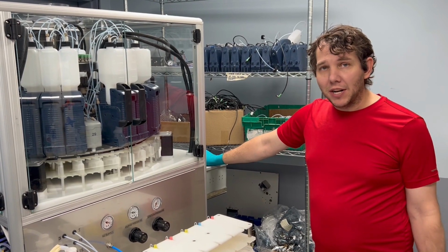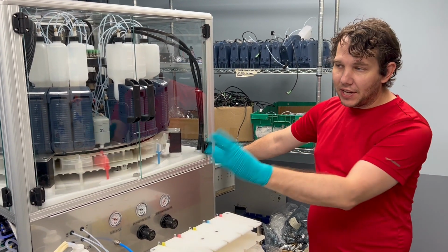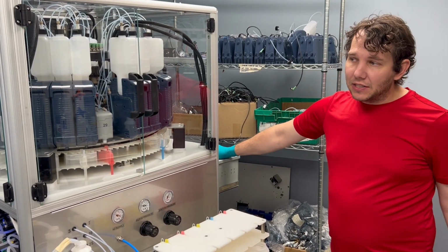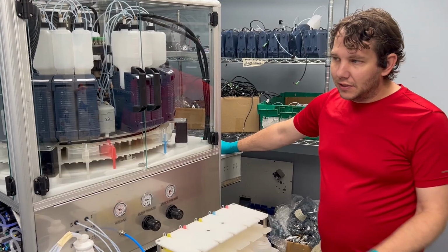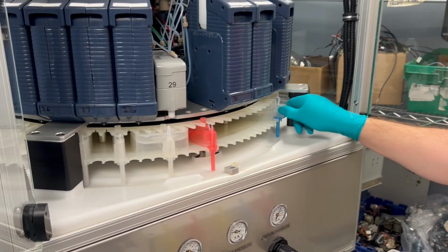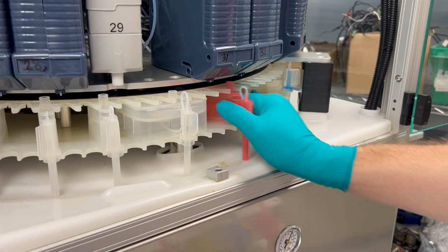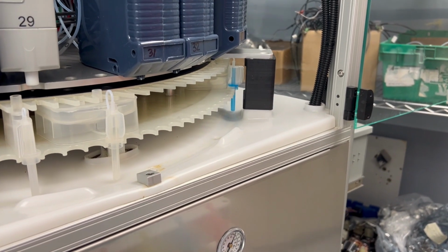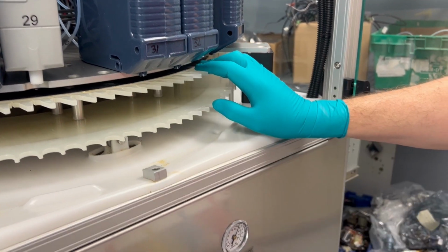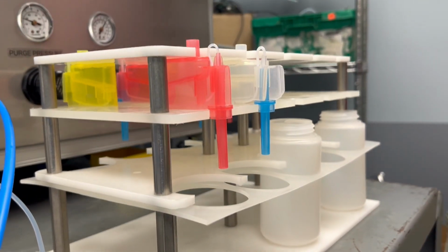Now that we have completed the process, as I had said in the video, you will click abort in order to stop it, because until then it is just going to do a mixing. So now that we have stopped it, it is a lot easier to click release carousel in order to allow you to move these to the front. Luckily, the ones we are requiring ended up right here. So we know this is number 1, so we can remove it and place it in the 1 section. Then the next one, which is well number 2, will go into here. And now we have all the wells that we pulled off this.